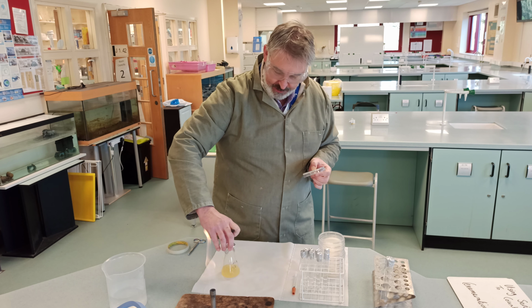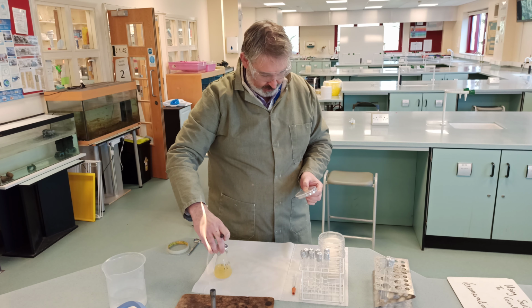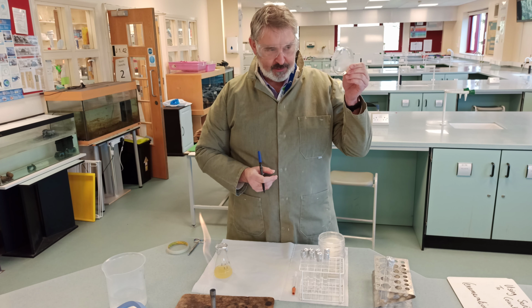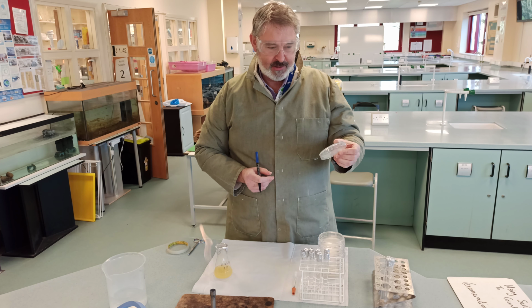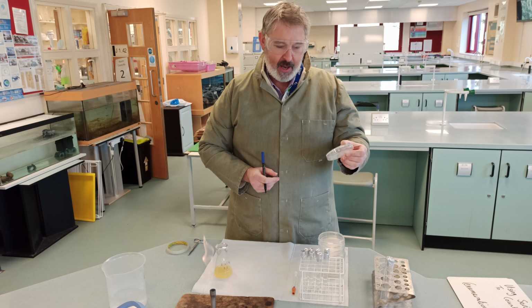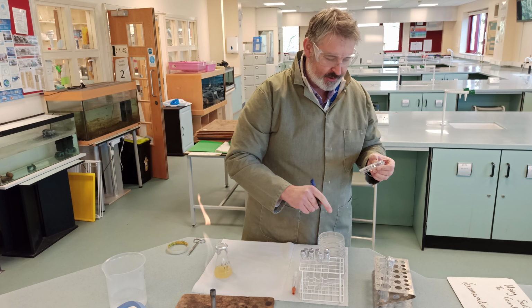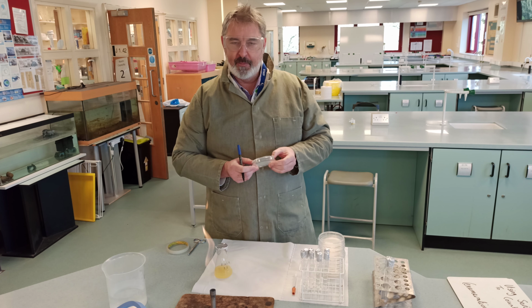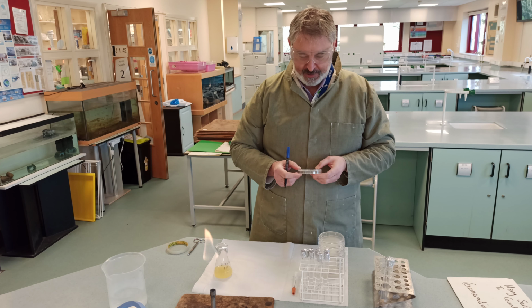Okay, you can see it's quite opaque. Okay, it's got quite a reasonable amount of bacteria in it, I would imagine. And I will be growing it on this plate here with a ml of it on the plate. Okay, I will then take a fresh tip and put a ml into each of these dilutions. So the first one will then be 0.1, etc., going down in our number of dilutions.